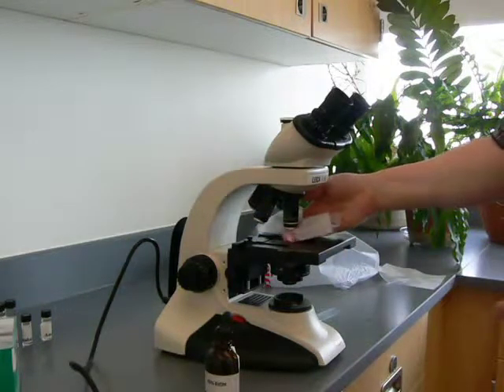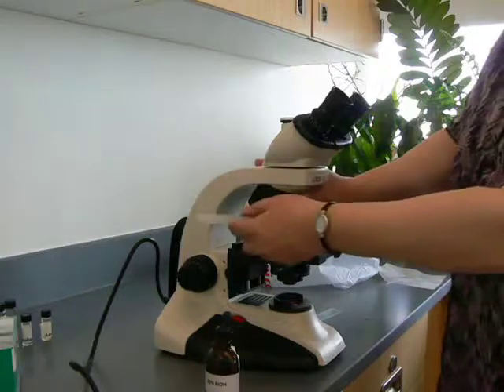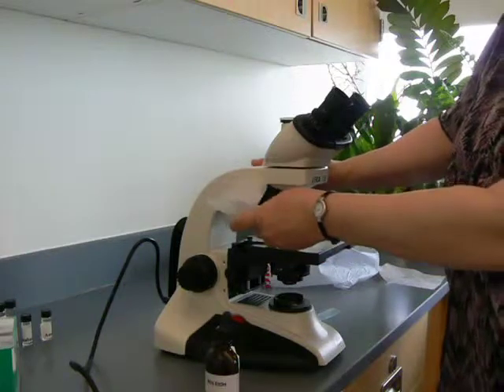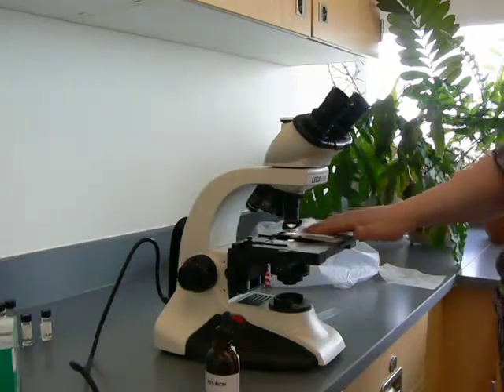When you're putting away the microscope after you've used oil, you want to clean all of the lenses. So I've cleaned that one. Now I'm going to go to this one — use a different spot on the lens paper. Clean this one. Clean that one. Get any oil that may have gotten on the stage off.